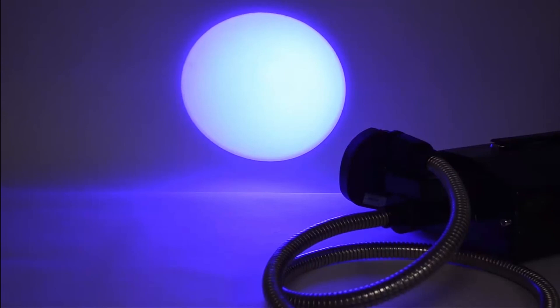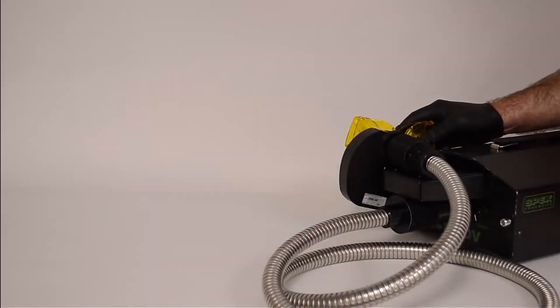To make sure the goggle you are using is working correctly, shine the light source on a wall or ceiling. Place the goggle in front of the light and make sure the light is fully blocked. If no light passes through the goggle, it is working properly.